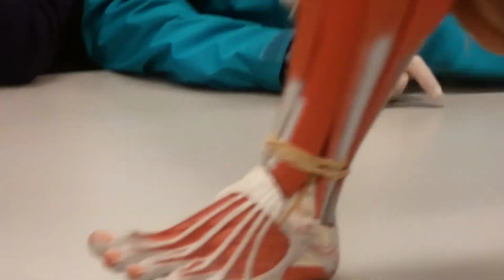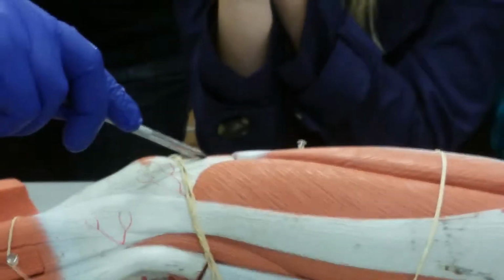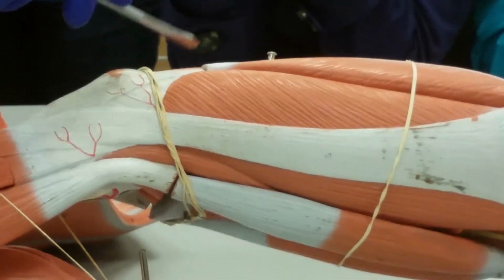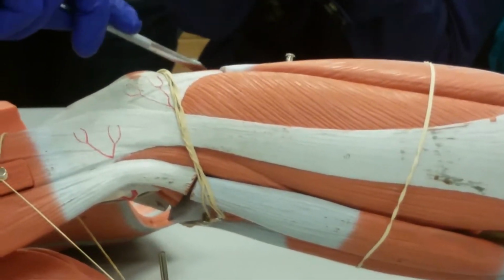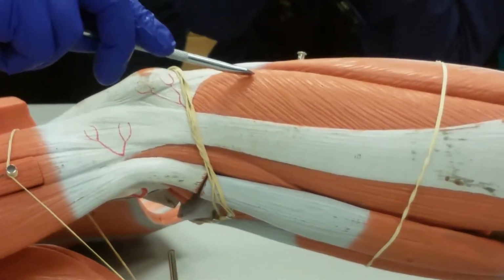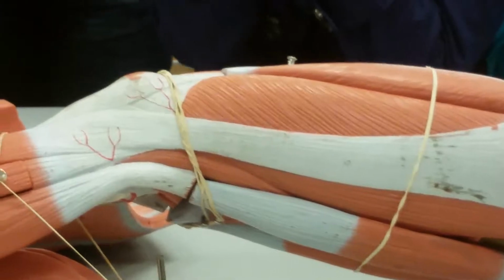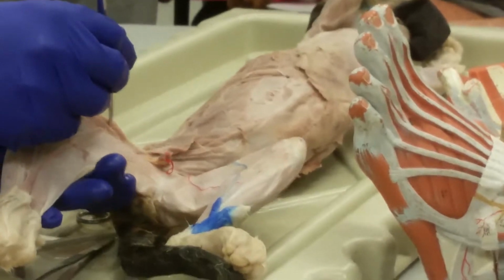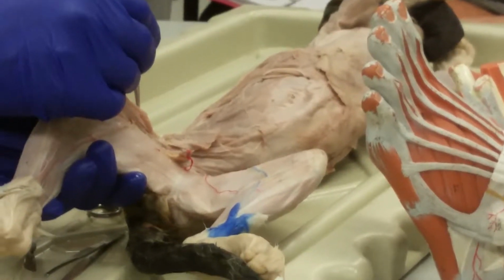Naturally, there'd be four quadriceps, so somebody can hold that leg up straight. Okay? Or flat down so that the front is up, but it's laying down on his back. Yeah, we just support it a little bit. So there's your patellar tendon, right? All four quadriceps insert into that patellar tendon. You see here too, these are the vastus muscles, the vastus medialis and the vastus lateralis. Okay, this is the rectus femoris. So we can see those same three on the cat: vastus lateralis, vastus medialis, and rectus femoris.